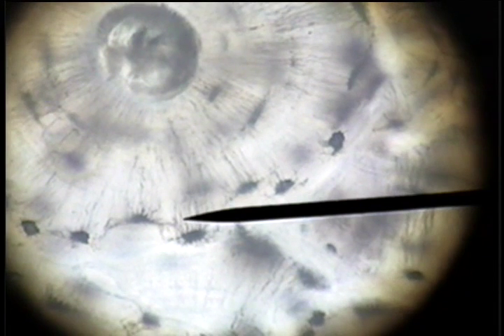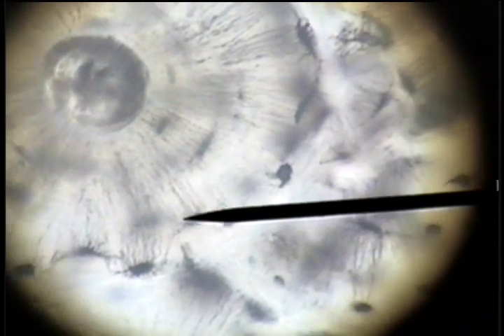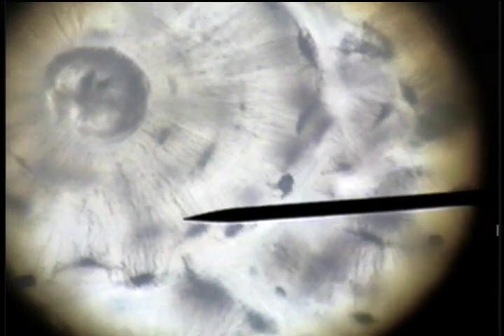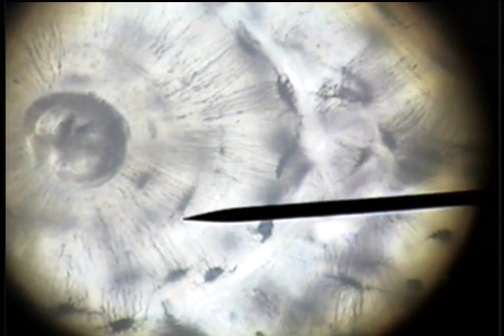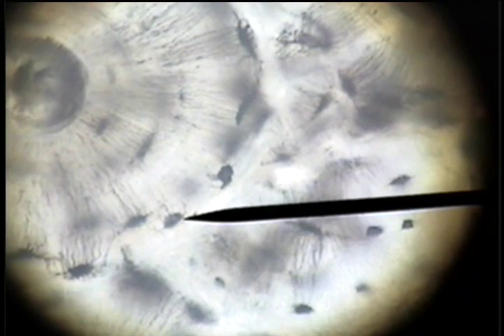Radiating from the osteocyte are these small dark lines. These are the canaliculi. And canaliculi connect one osteocyte to another osteocyte to carry out the living dynamic metabolism of the bone.